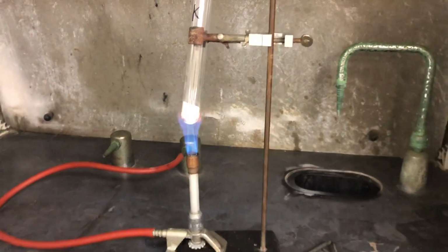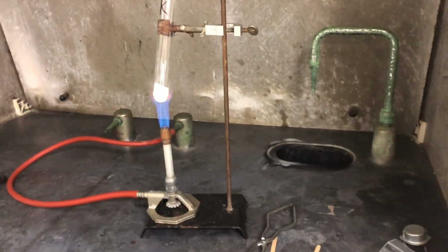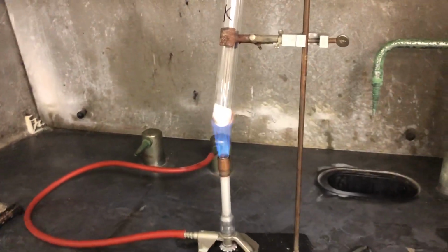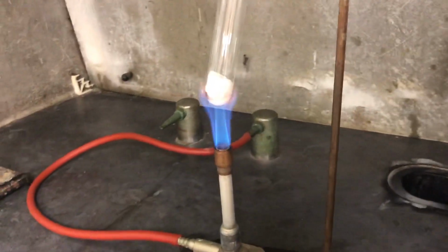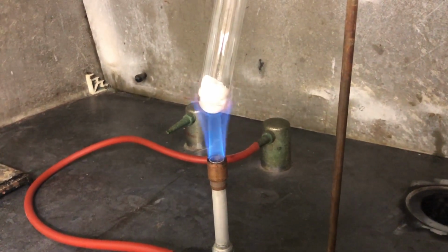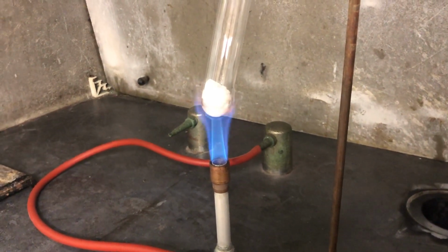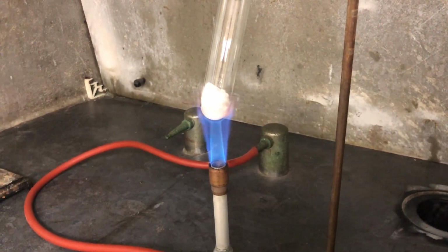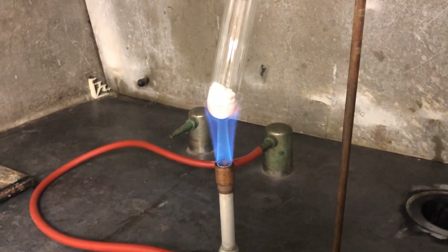As you can see, there is already some liquefaction occurring as the crystalline structure is melted to create the liquid form, and which also releases the gas.